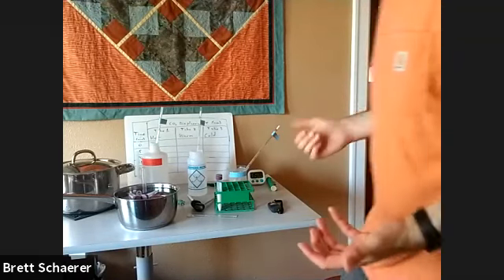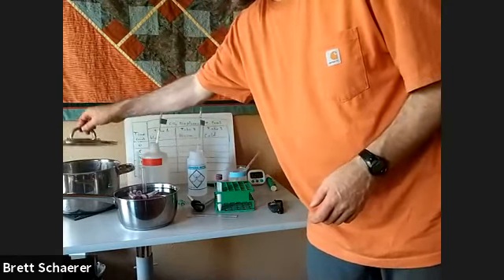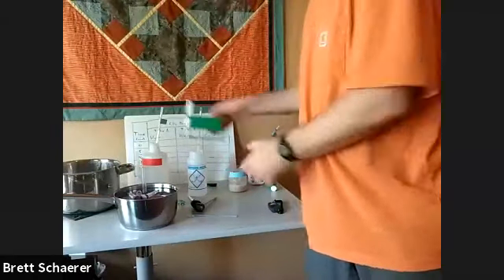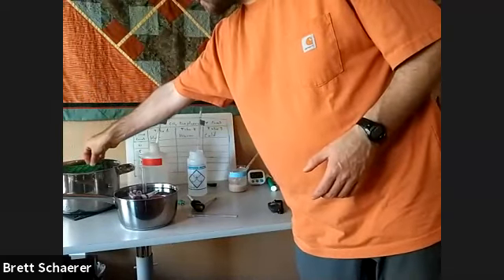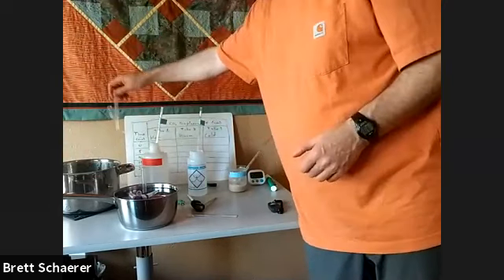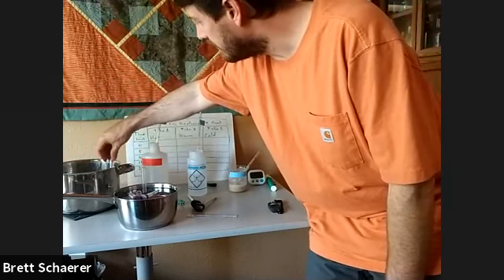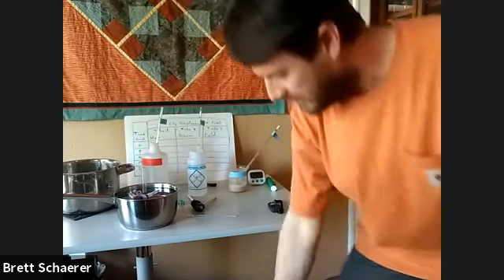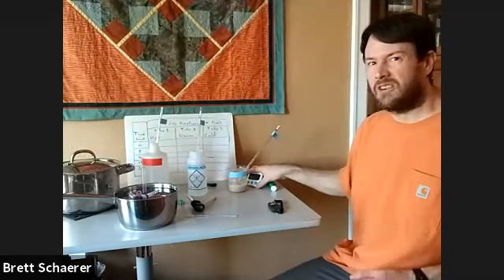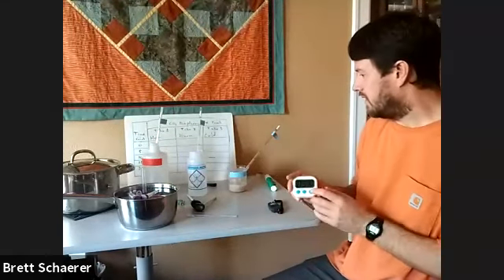And then I'm going to be especially careful with the hot environment. It's probably a little too hot for my fingers to stand. So I go in very carefully with the whole test tube rack, so I don't have to fish those out later. And then I will also put the tube in. Okay. So I'm just going to start a 5-minute timer, let those acclimate, and I'll pause the video.